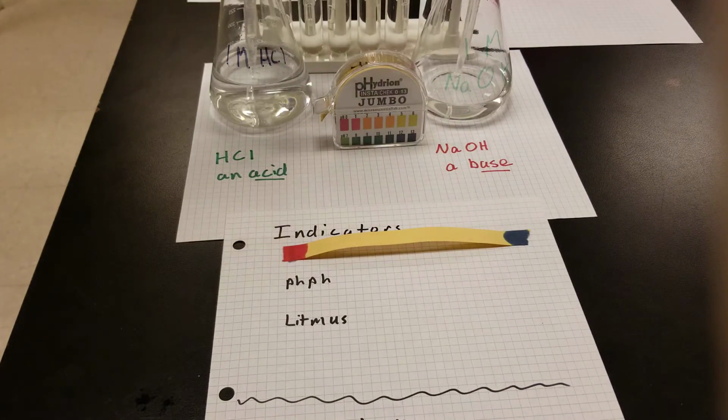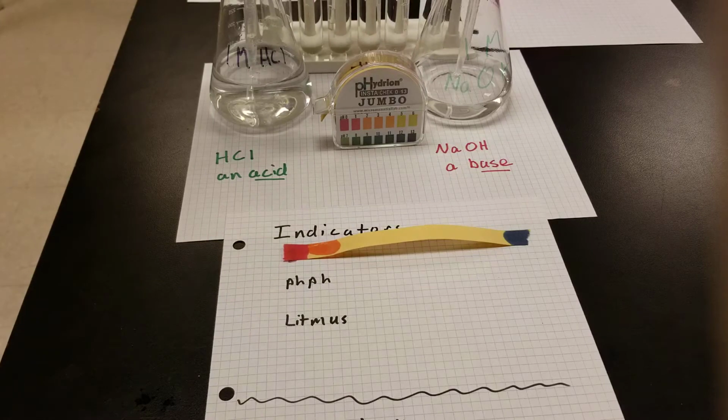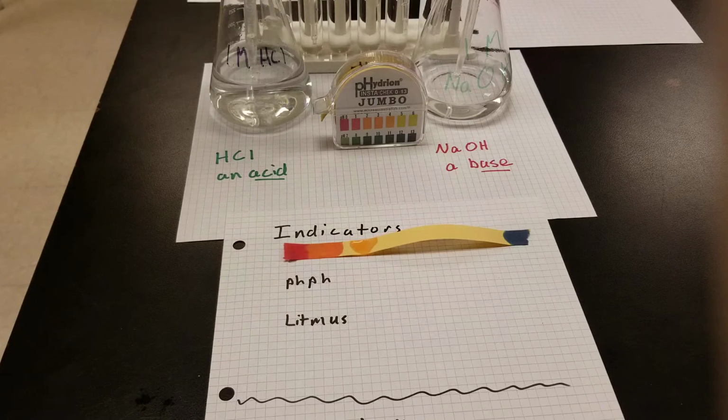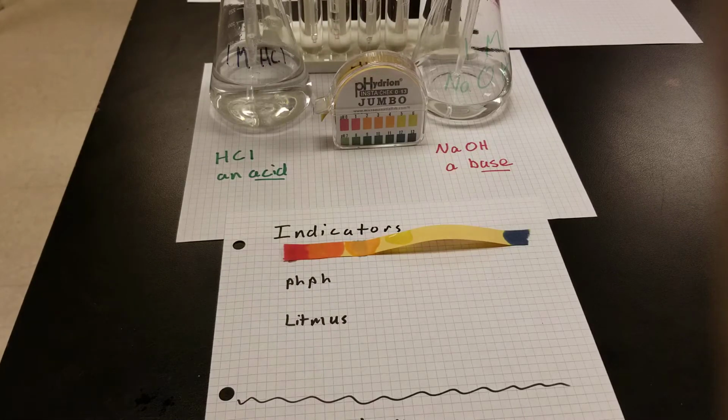Let's see about other solutions. I've mixed a little bit of acid with water. I've diluted that acid, and it changes the universal indicator paper to a different color, indicating that pH is around 2. And this guy, it's a little bit closer to neutral. It looks like the pH is around 4. This guy, this is just plain water. That's the color of the paper by itself. It gets a pH right around 7.